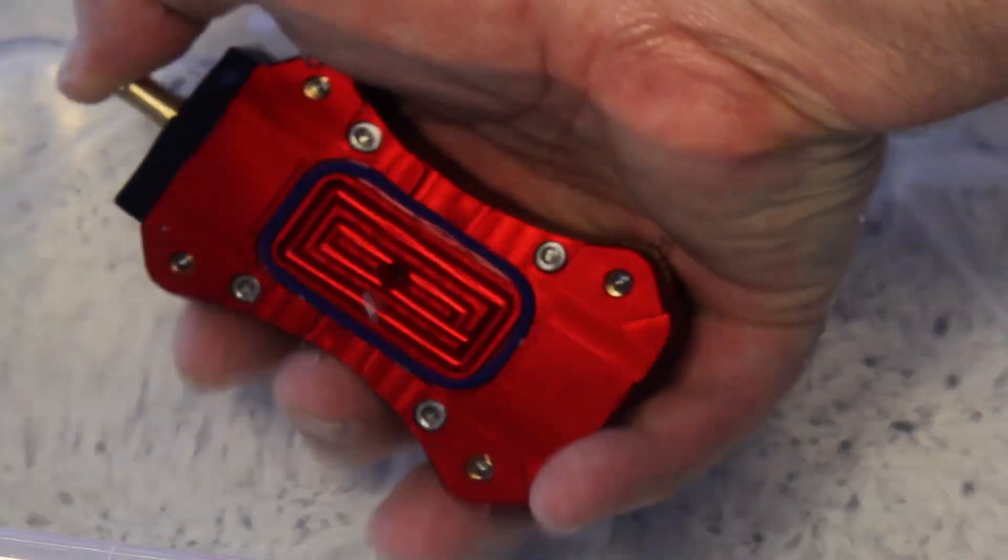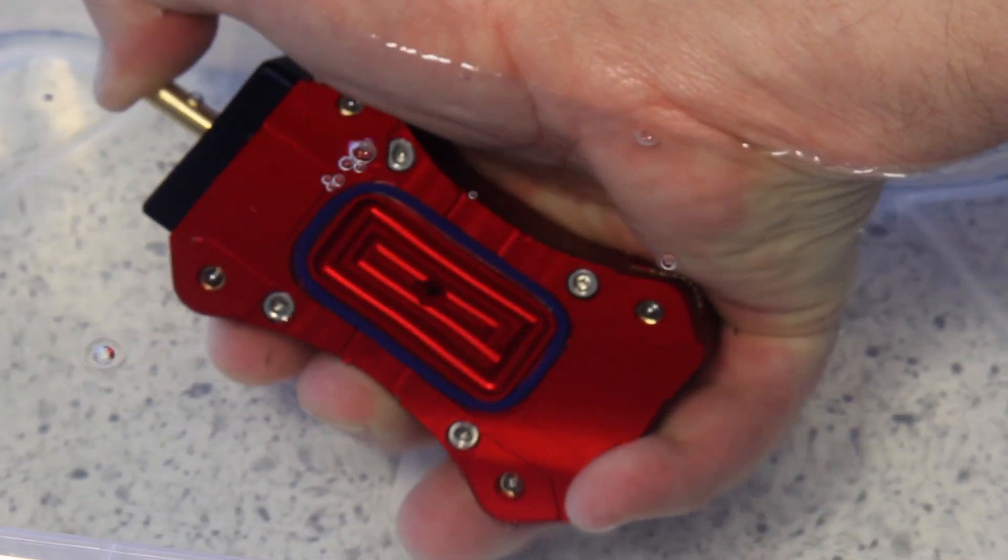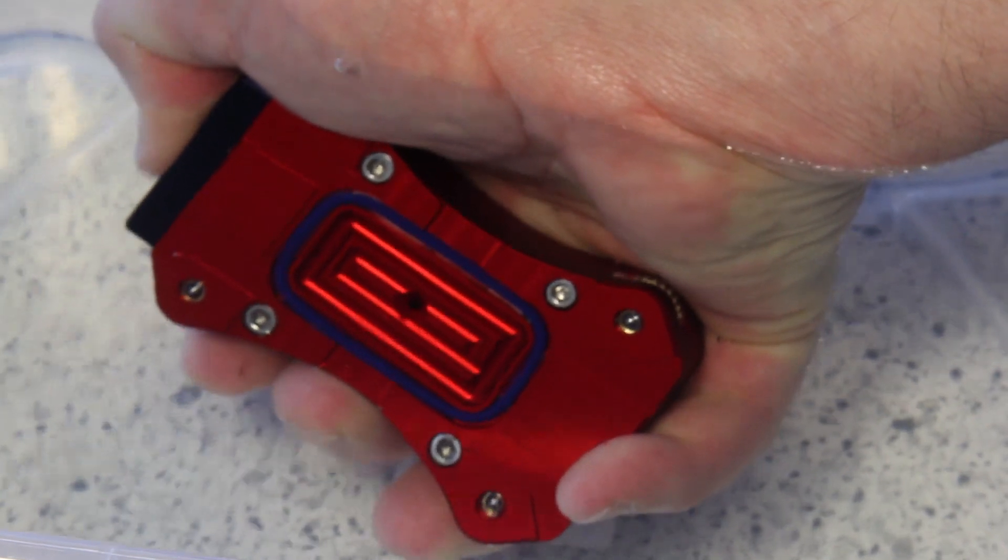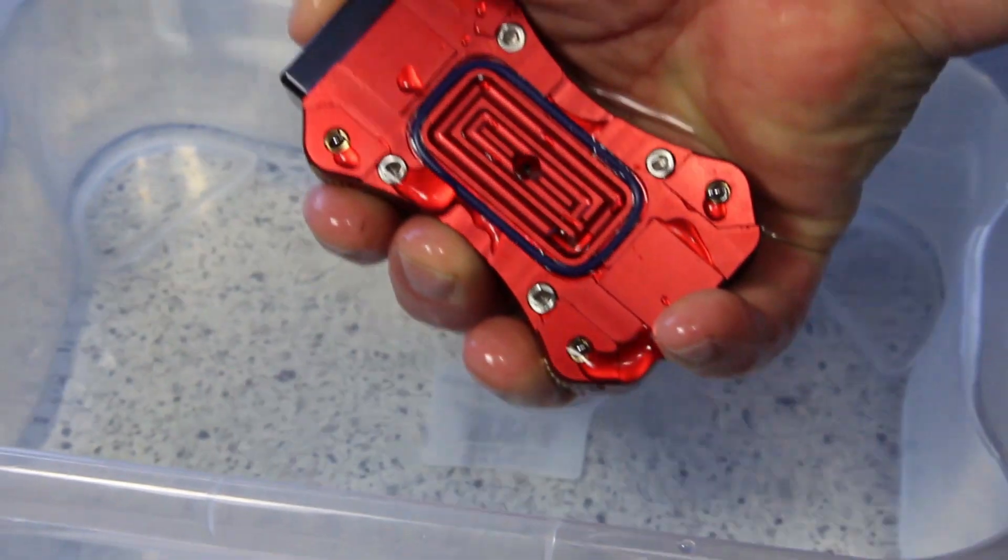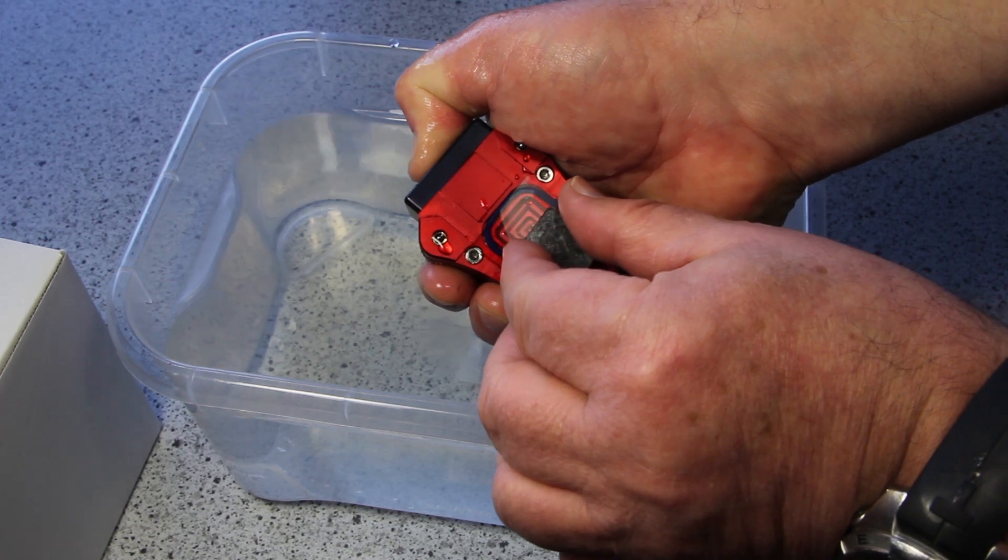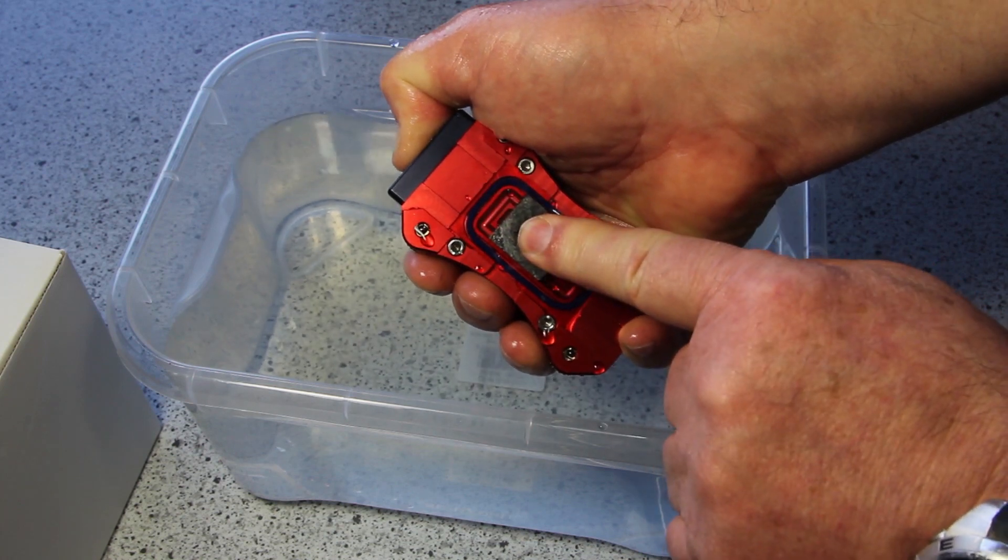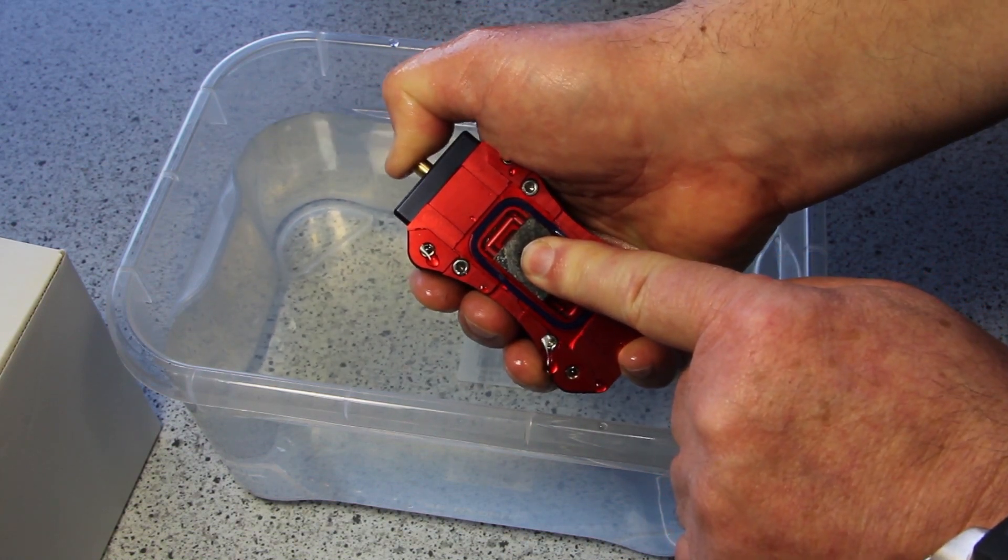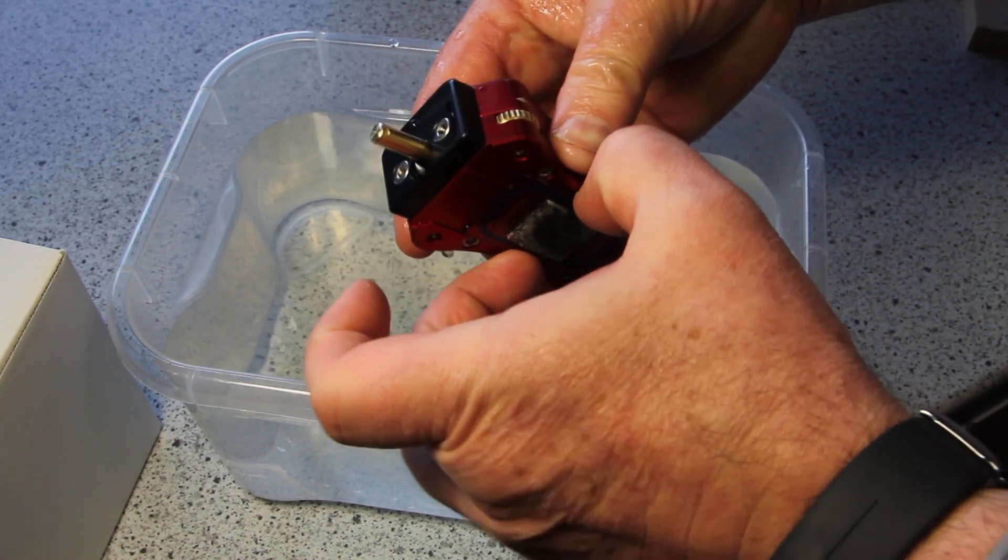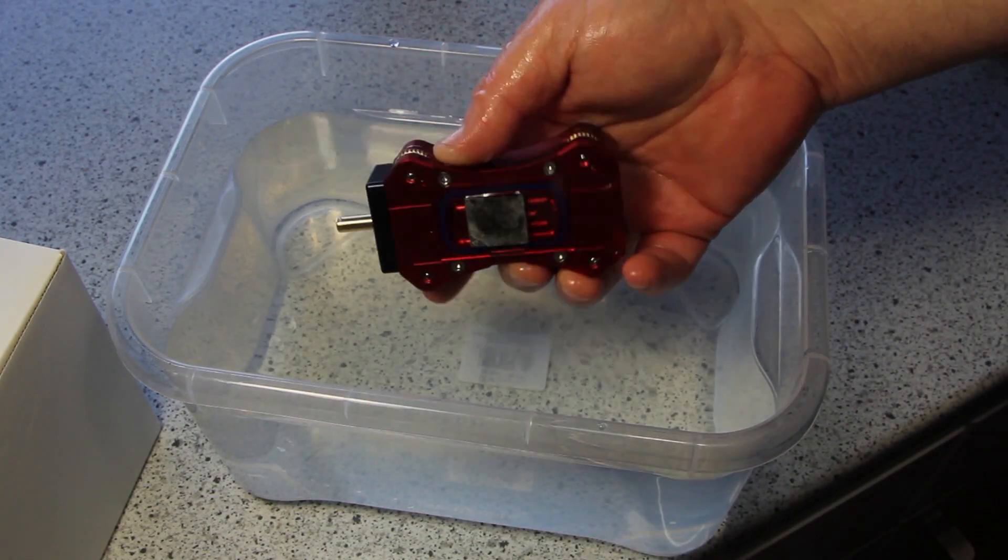I hold the mouse under water. I pump the air completely out. Then I press the button. I hold it firmly down. I take it out of the water. I put the sample on it. It has to fit. I hold it down, the sample, and then I release the button. Now it's firmly sucked on. Now we can work.